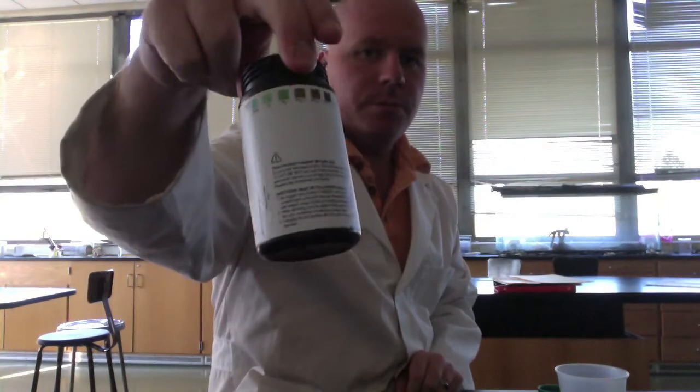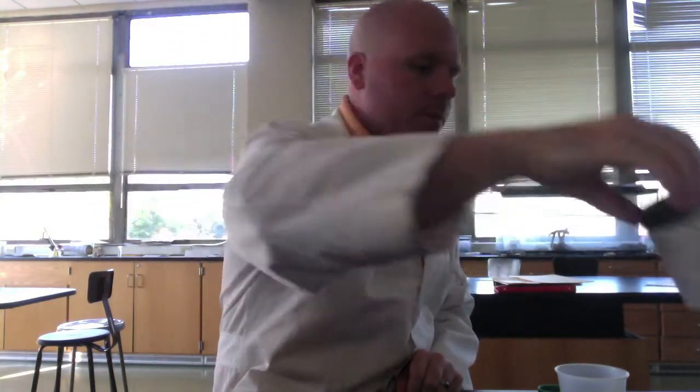All right, and I also have these testing strips. They're for urinalysis. They can tell you if there's a buildup of glucose in your urine. We're not going to use them for urine today. We're just going to use them to test glucose. So here's what a test strip looks like. There's the color of it. This is before it's been tested.